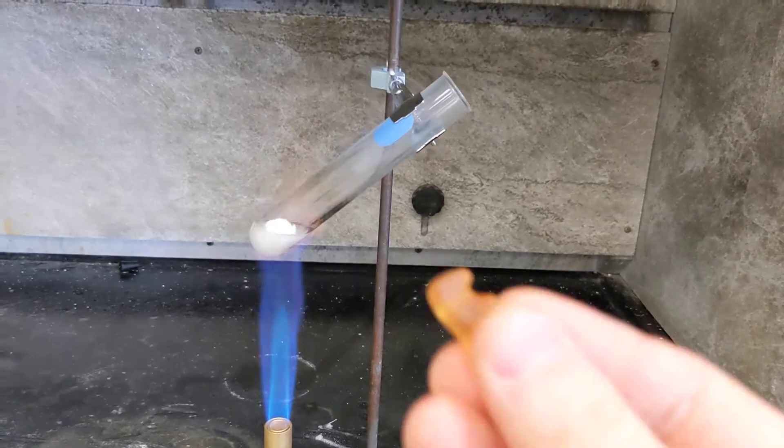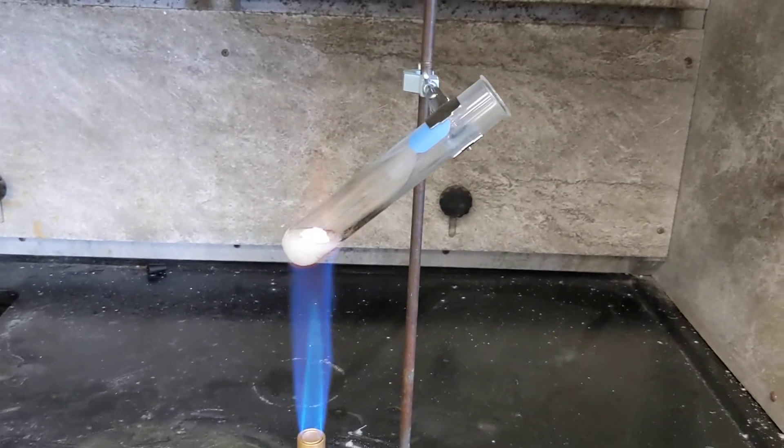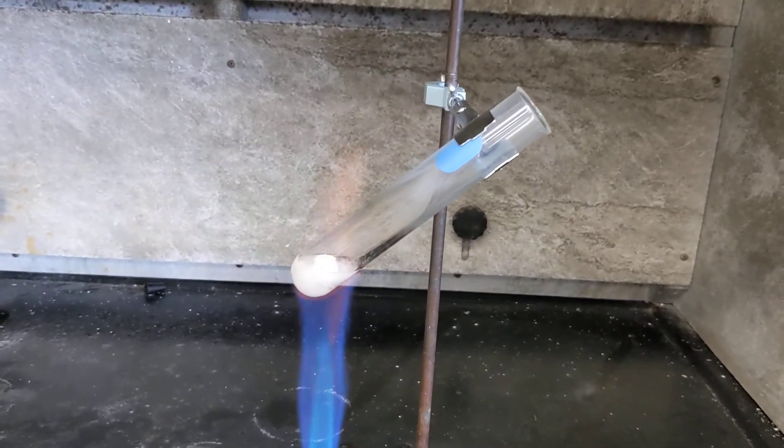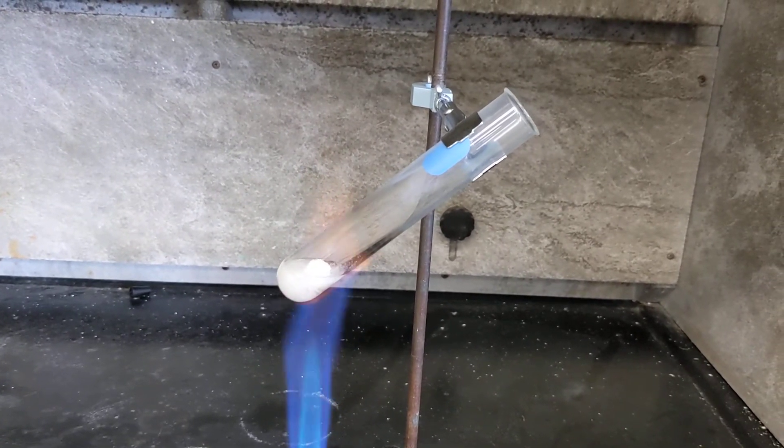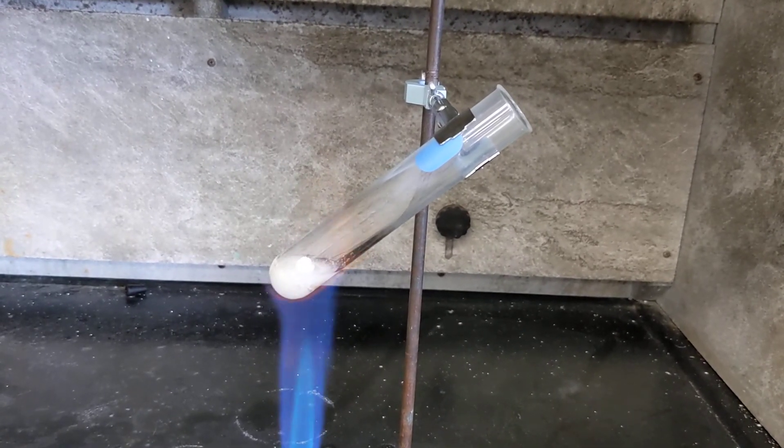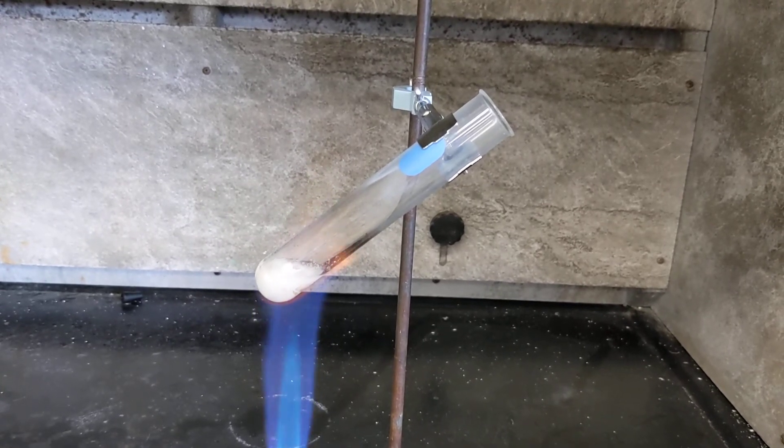Or burning it in your stomach would burn even slower. So we'll get a nice oxidation reaction, combustion reaction happening here. All right, we're very close. Okay, here we go. I'm going to remove the heat just to get it out of the way once we're molten.